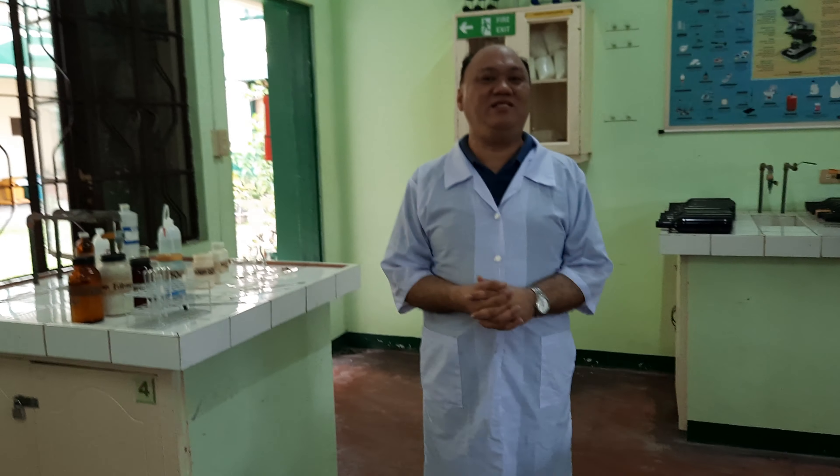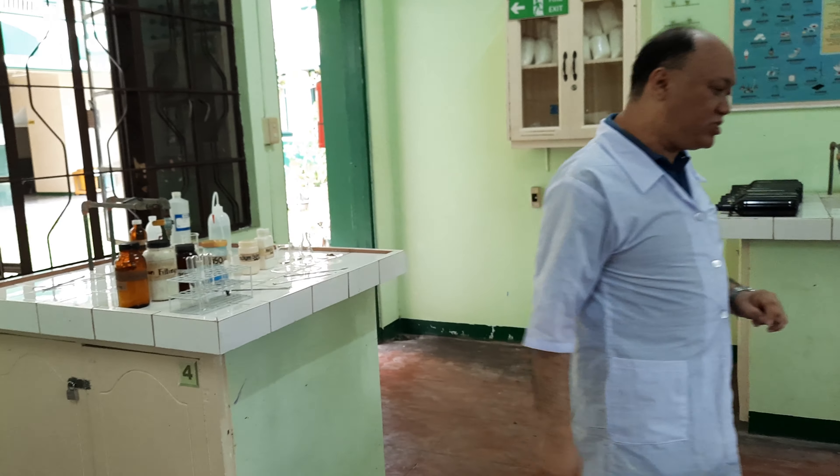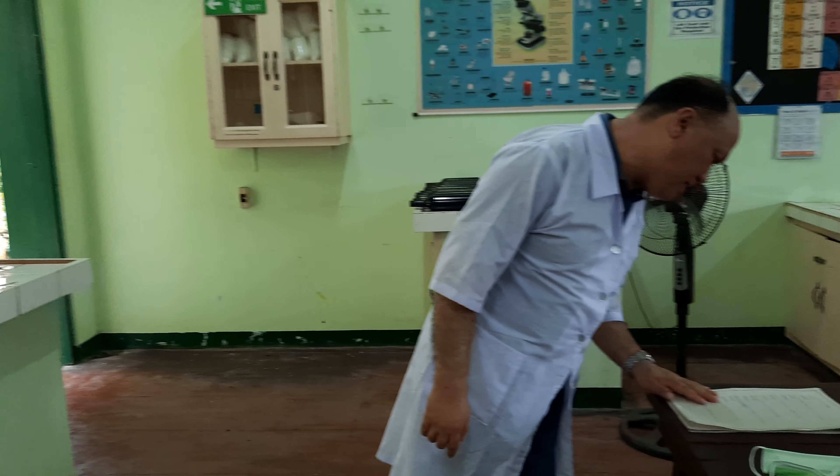Okay class, let's continue. Now we are on procedure number 5.